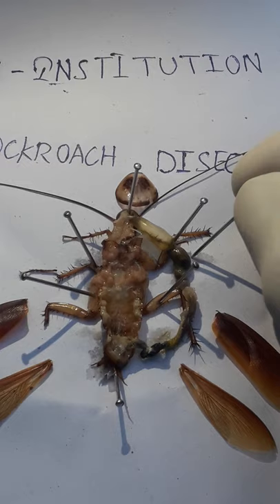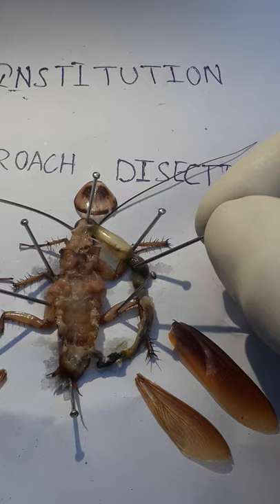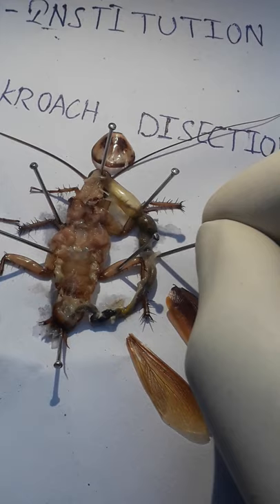This is the gizzard, where food material is digested. This is where the cockroach processes the type of food material it consumes. After the gizzard, there are follicle-like structures present.